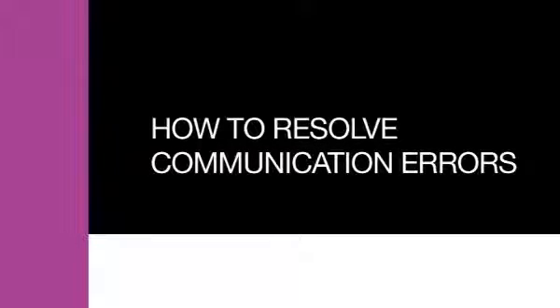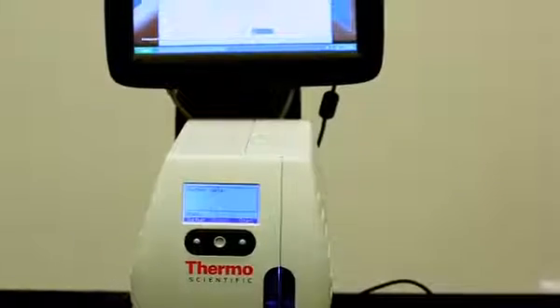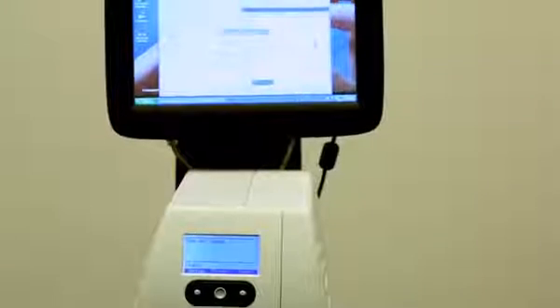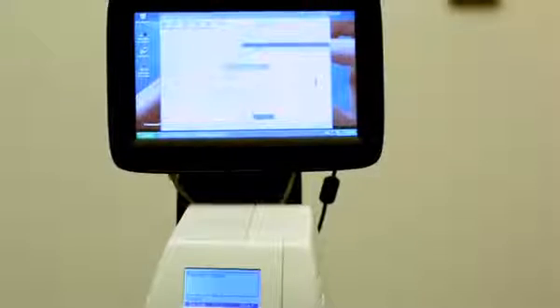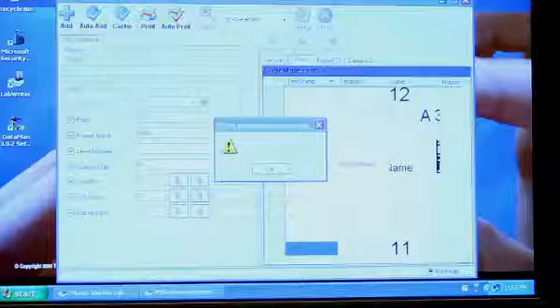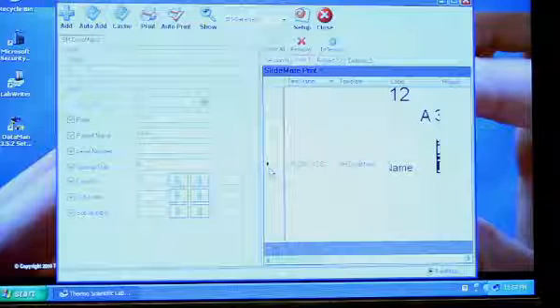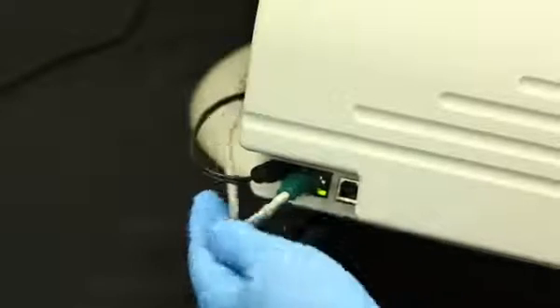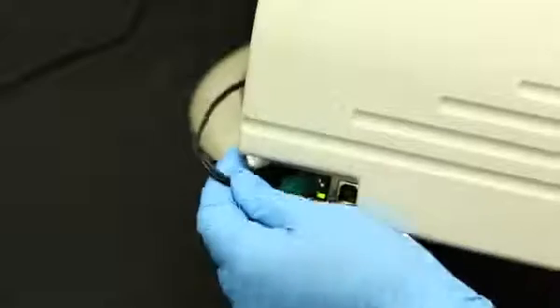How to resolve communication errors. Thermo Scientific LabWriter software communicates with the SlideMate by sending an image either by the crossover cable or a network IP if you are interfacing the SlideMate with your LIS. If you receive an error, close the error by clicking OK. Close LabWriter. Power down the SlideMate by pulling the black power cord from the back of the SlideMate.